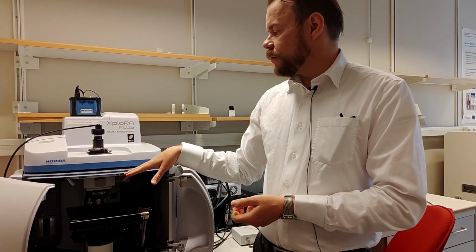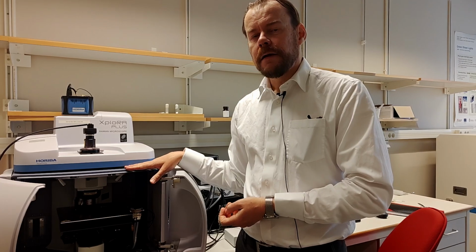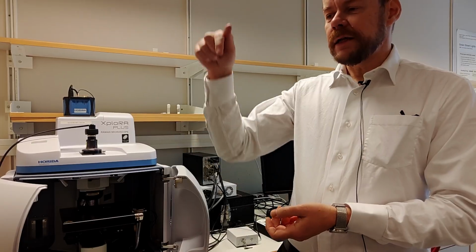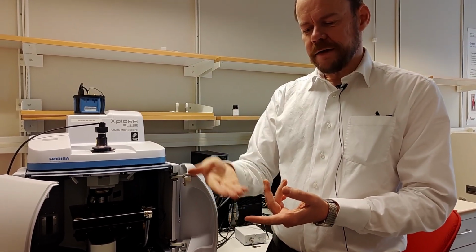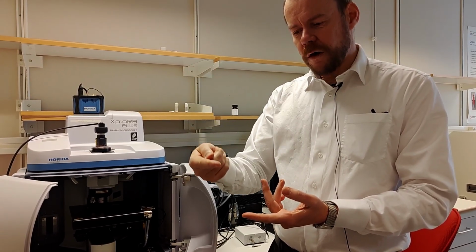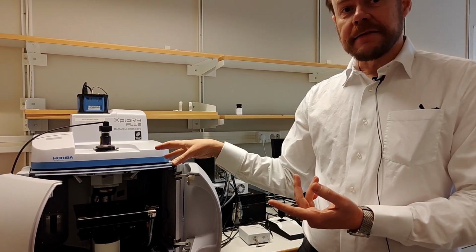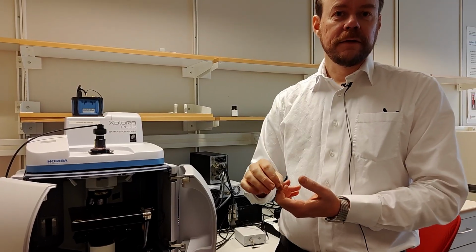The microscope is what is called a confocal microscope. What that means is that the information comes from the focusing point. So when the laser shines on the sample, it doesn't reflect the Raman intensity from all the parts that the light is traveling through in the sample, but only where the focus is. That is very nice, because then you can make depth profiles.